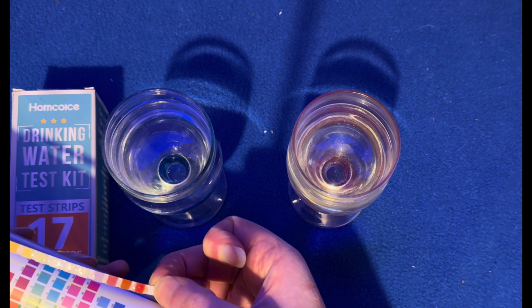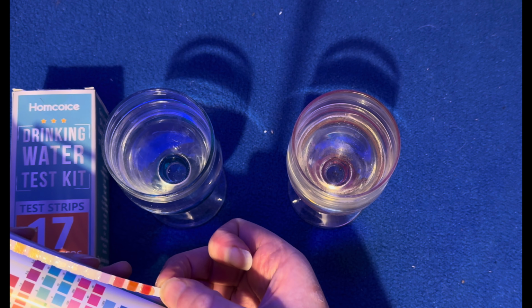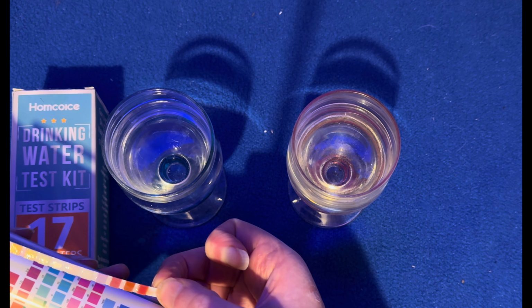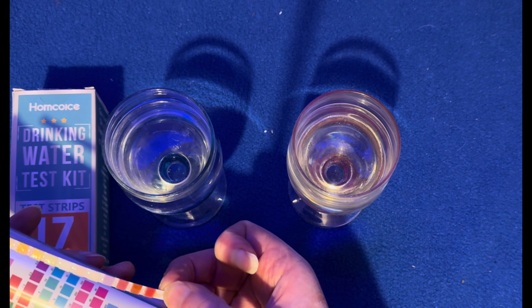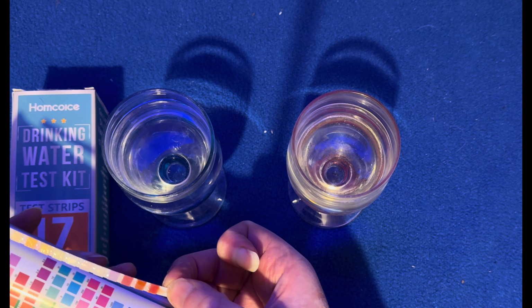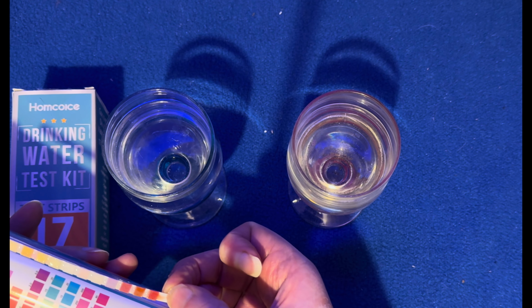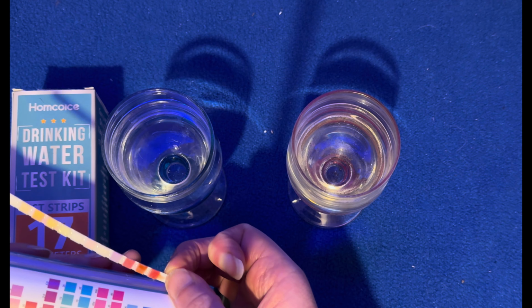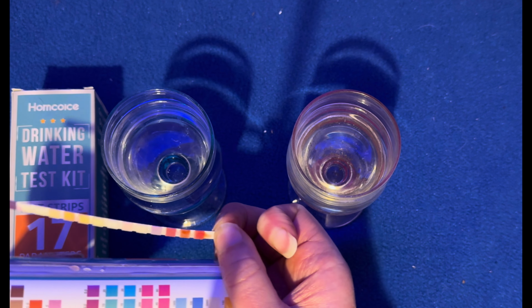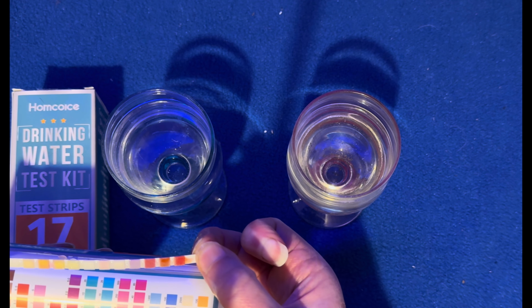So the top strip, you can see it's gone a medium shade of green, and that would indicate the alkalinity was about 120. The next one down, which is the pH, is about 7.2, about in the middle. The next one is hardness, so it's quite hard. You can see it's all the way over the other side, and that ties in nicely with the parts total dissolved solids that we measured earlier.